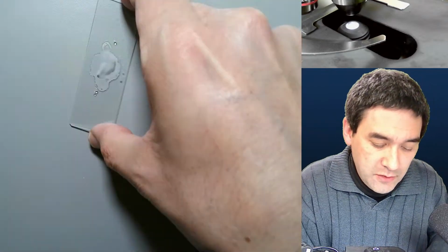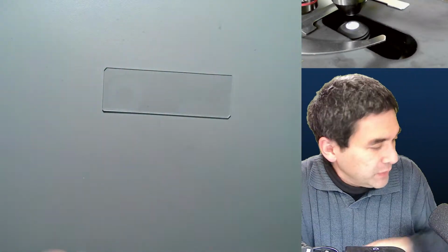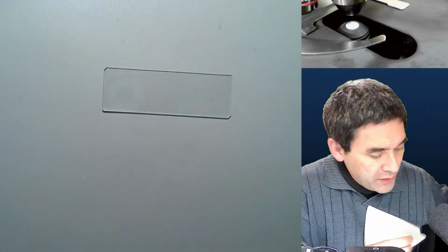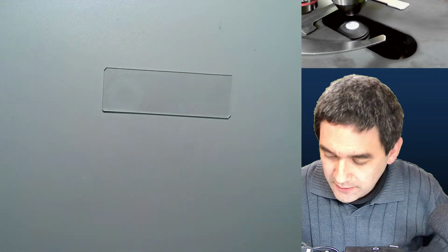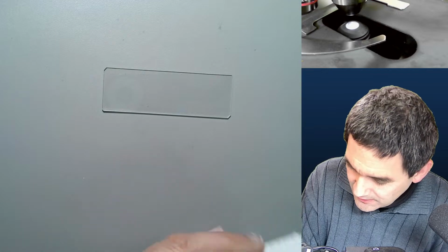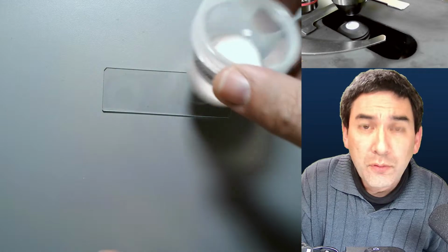to those substances here. What I'm going to do now is give you a demonstration on one of those substances I have prepared. However, we are not able to wait until it crystallizes because it would take too much time. That's why we're going to be looking at the others. First I would like to give you a little demonstration concerning citric acid, not citric acid. Where is this? Vitamin C. It's ascorbic acid. Here it is. That is vitamin C, pure vitamin C.